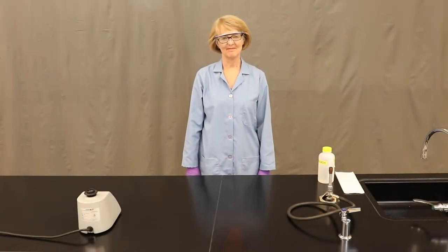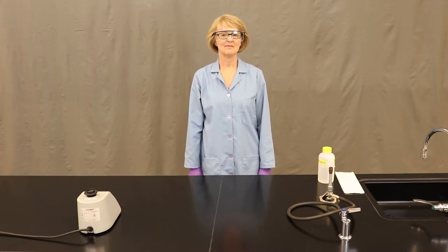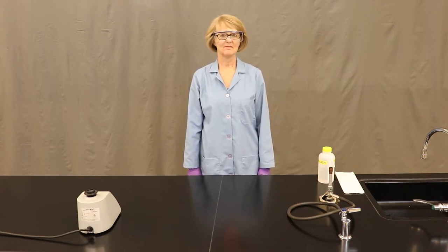Welcome to Bio 205 Microbiology at Pima Community College. We're here with you today to demo how to create bacterial smears using liquid and solid cultures.